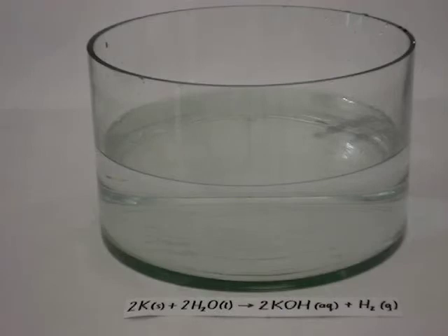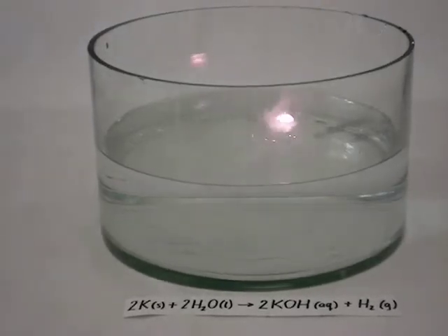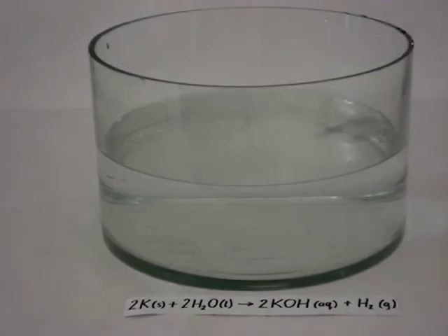Let's take another piece and see another one. Again, we take another piece of potassium and we see it reacting with a purple flame. Thank you.